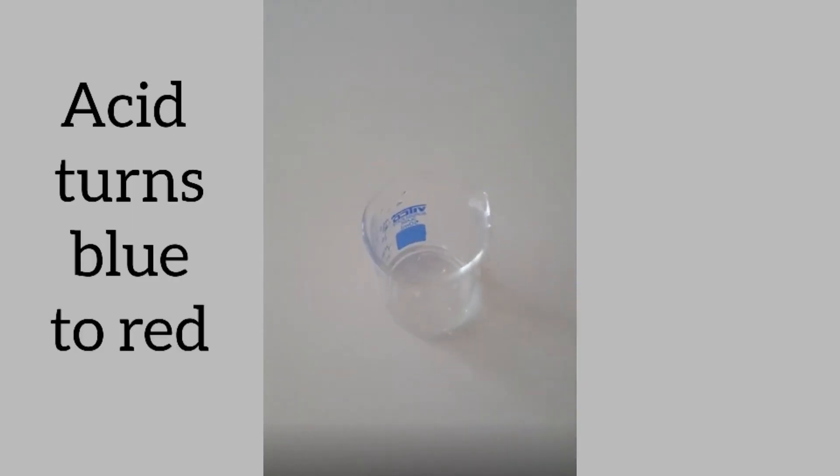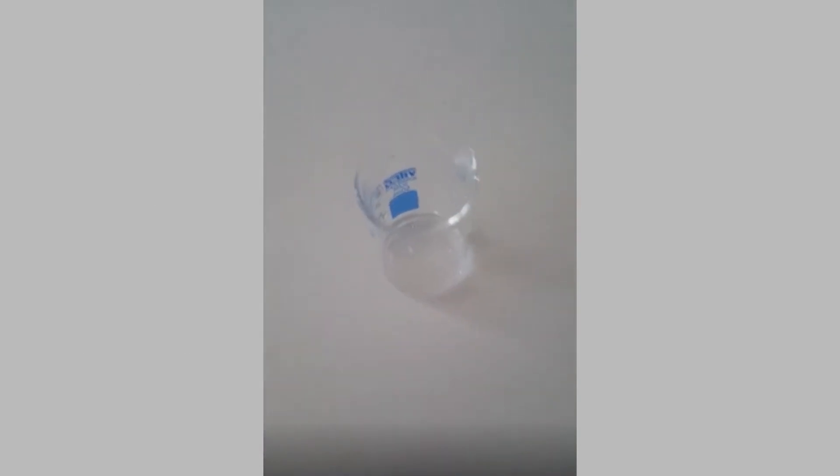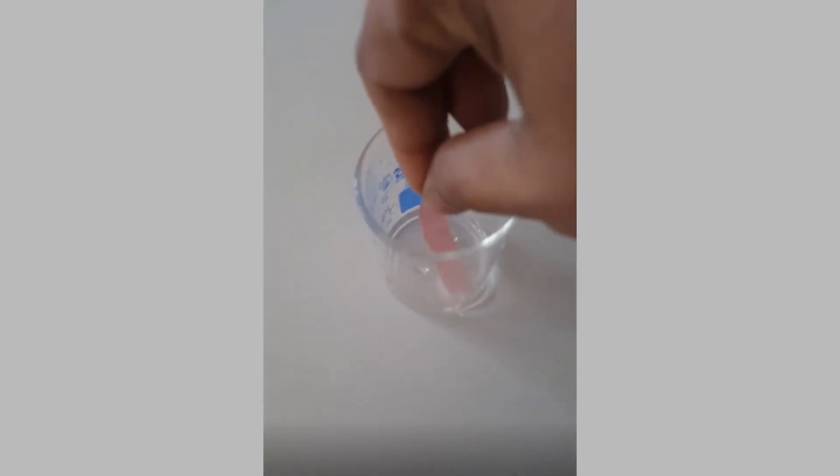What does it mean? It means that the given solution is an acid. But I have another doubt now. Whether the solution makes any change with red litmus paper, I am going to test that also. I am going to dip red litmus paper in the same solution.